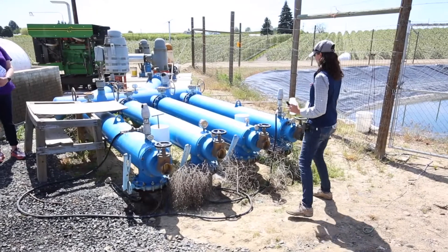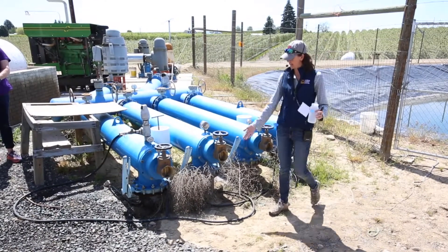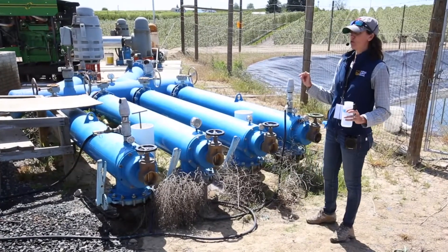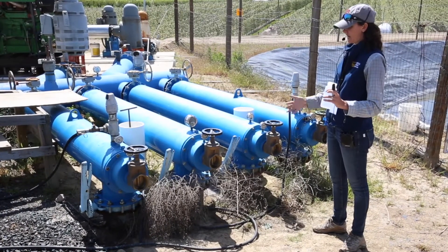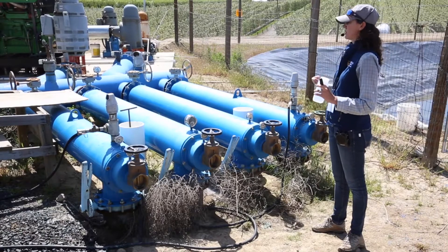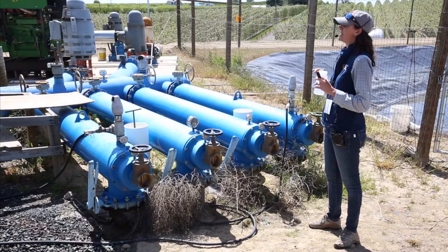There are two possible options here. One of them is this really convenient-looking black hose that's attached right here and kind of laying on the ground. That looks convenient — that's also gross. It's been laying on the ground, we don't know what's inside there. In order to flush that out to make sure we've got a clean sample, it's probably going to take you more time. Garden hoses like this are convenient but they're not a great idea.